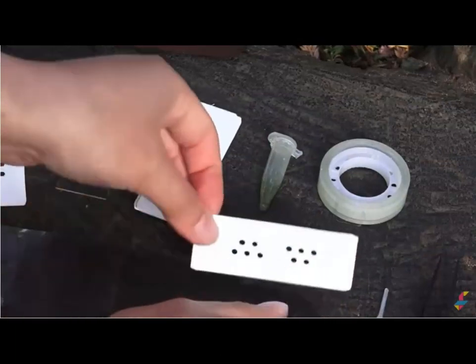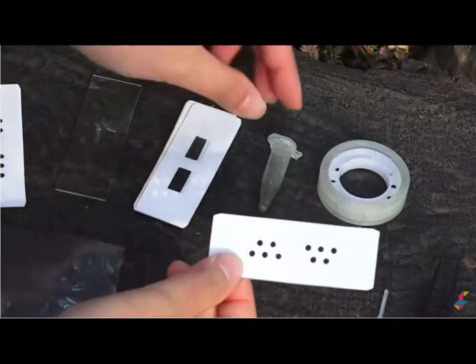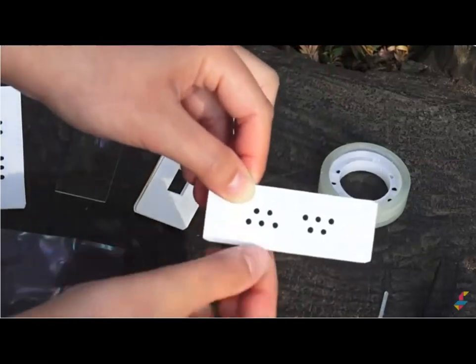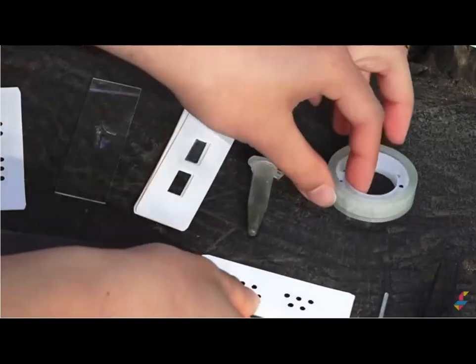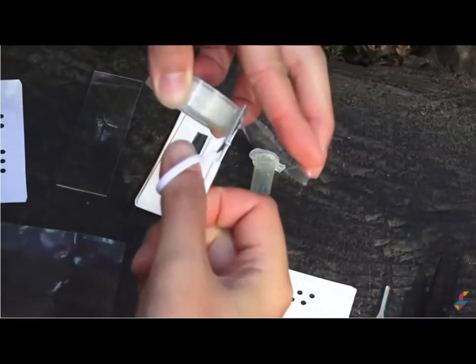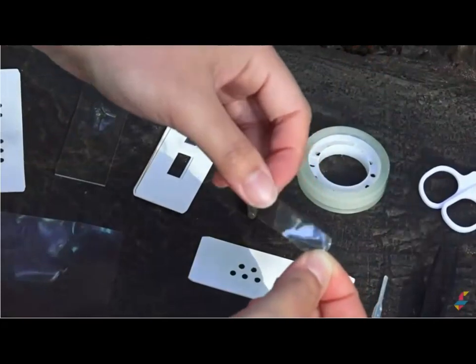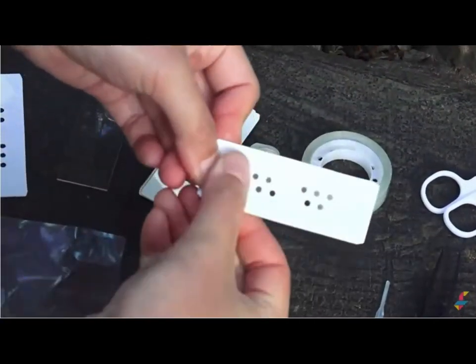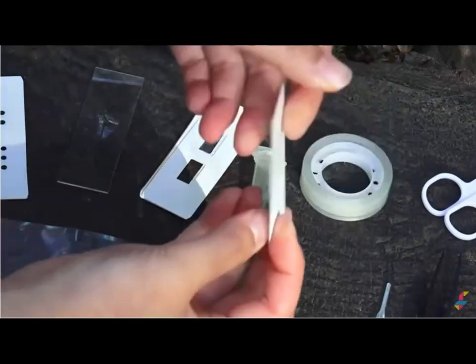Now let's practice preparing a sample with a microwell paper slide. These are great for pond water samples, which I have here. And if there are any swimmers in here, they get trapped in these tiny wells so that you can see them clearly. The first step is to put a strip of cellophane tape. You can cut it with the scissors like that. And put it over the microwells like this. And make sure that it's attached to one side.